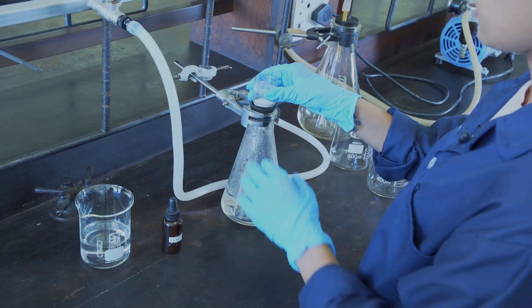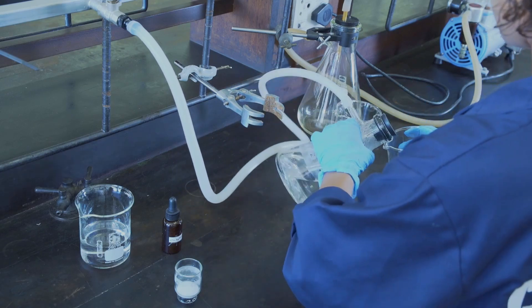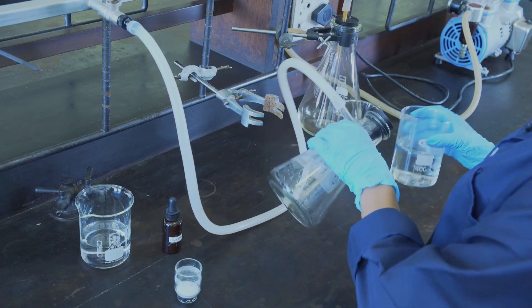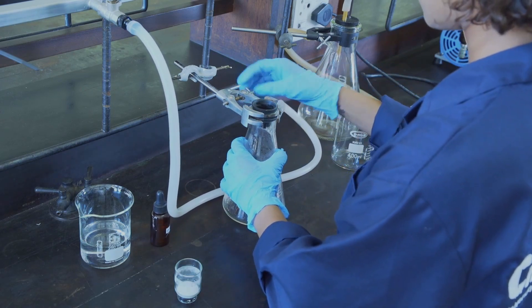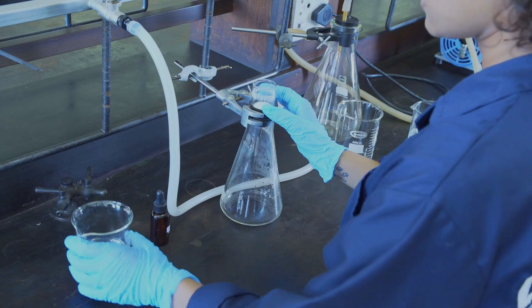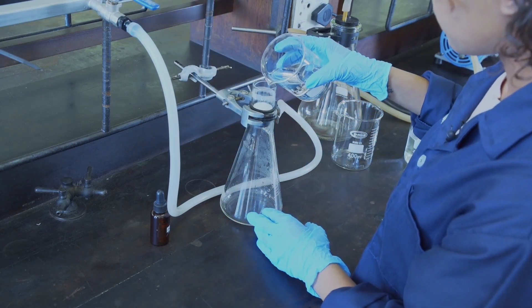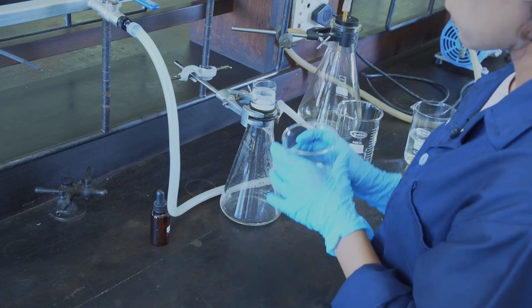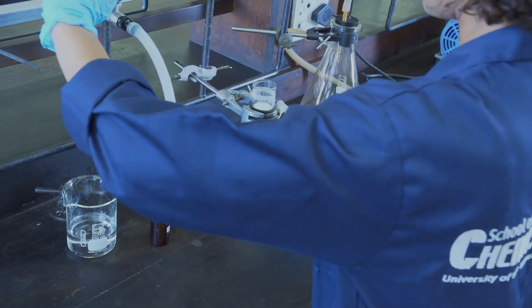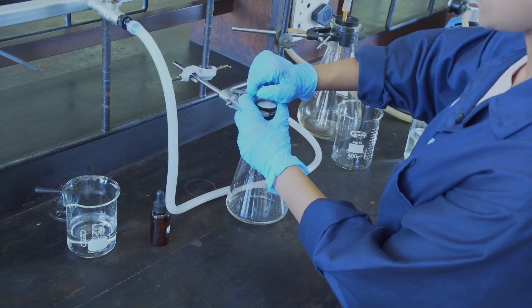After you have poured out the solution from your sample beaker, you can then take out the crucible and discard this liquid. We are now going to rinse the precipitate with hot water. After you have rinsed with hot water, you need to test the washings with silver nitrate in a waste beaker.